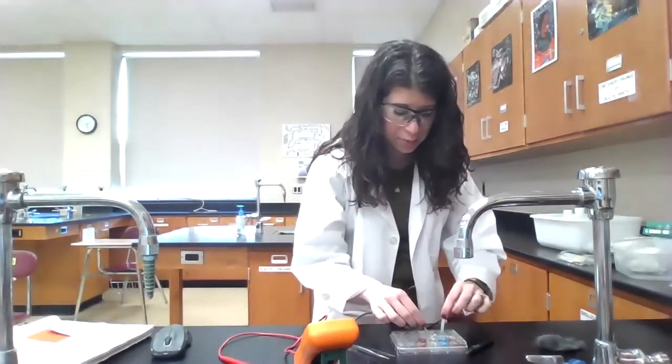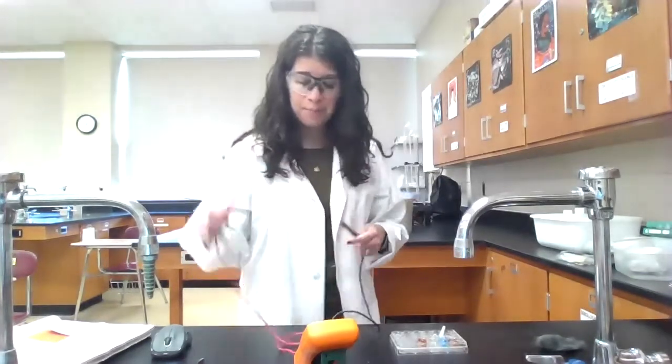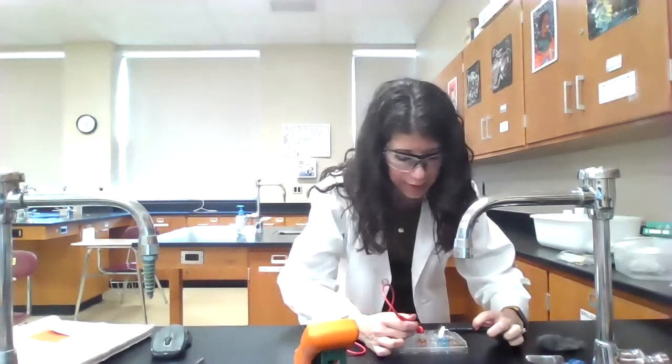And sometimes I just kind of push the little filter paper down a little bit using the metal strips. Now I want to be consistent here. Now that I know the black one is the anode, when I test zinc, I'm just going to make zinc the anode for every single one. So I'm going to leave the zinc one attached to black, and the silver I'm going to do with the red wire. So I connect these, and I'm getting a much higher voltage here. So this one is reading at 1.37, okay?